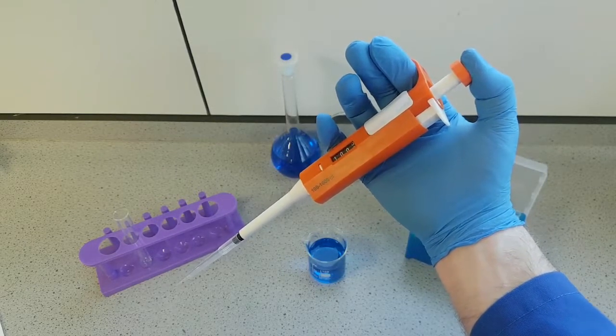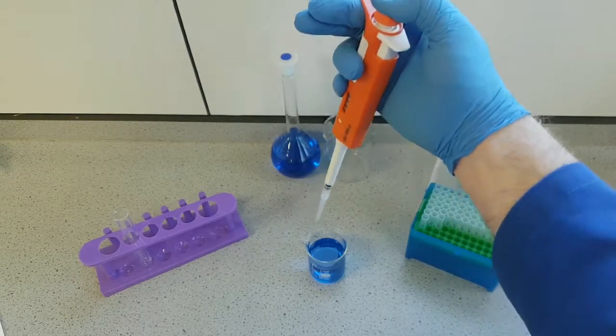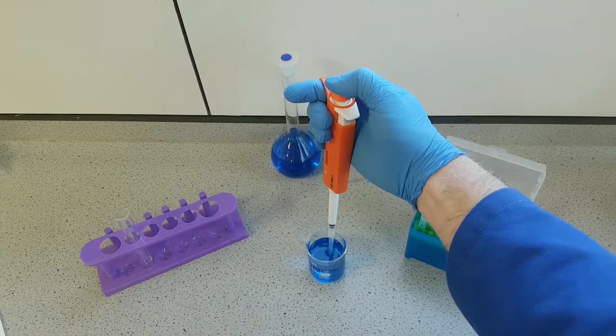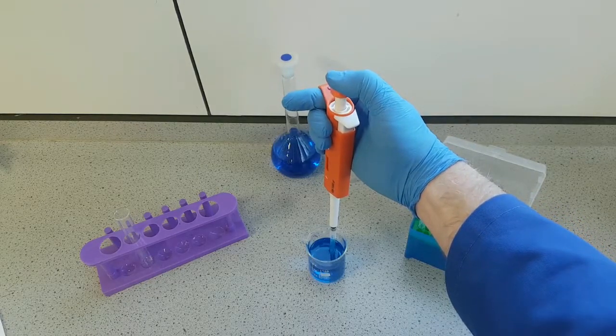To draw up our sample, we need to go down to the first stage, and then insert into our solution of interest. Lift your finger up slowly, or your thumb up slowly, to draw the sample up.